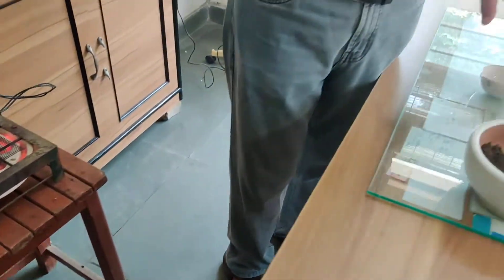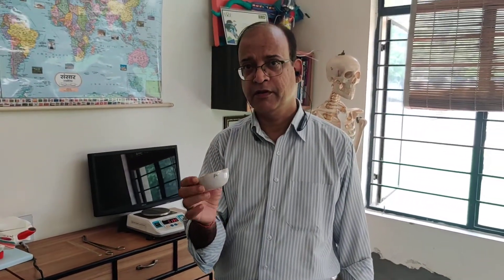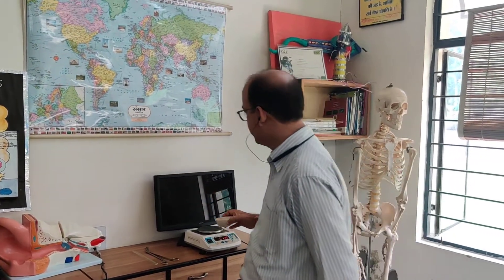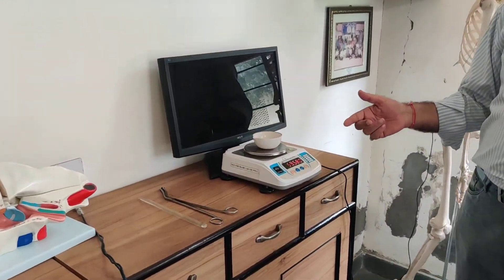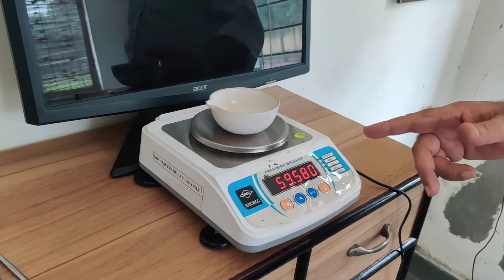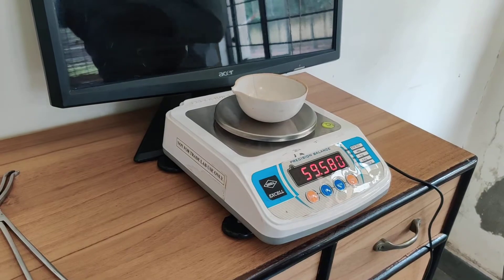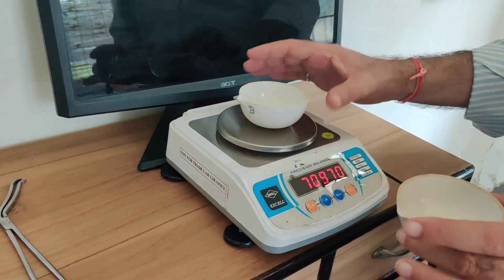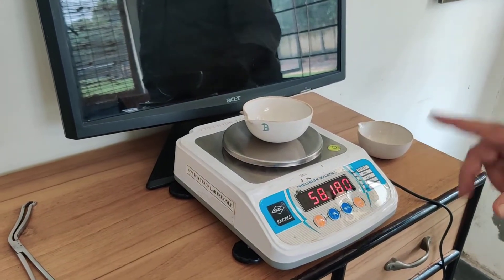First I will take the weight of these empty crucibles. This is crucible A, and its weight is 59.580. This is crucible B, and its weight is 58.180.